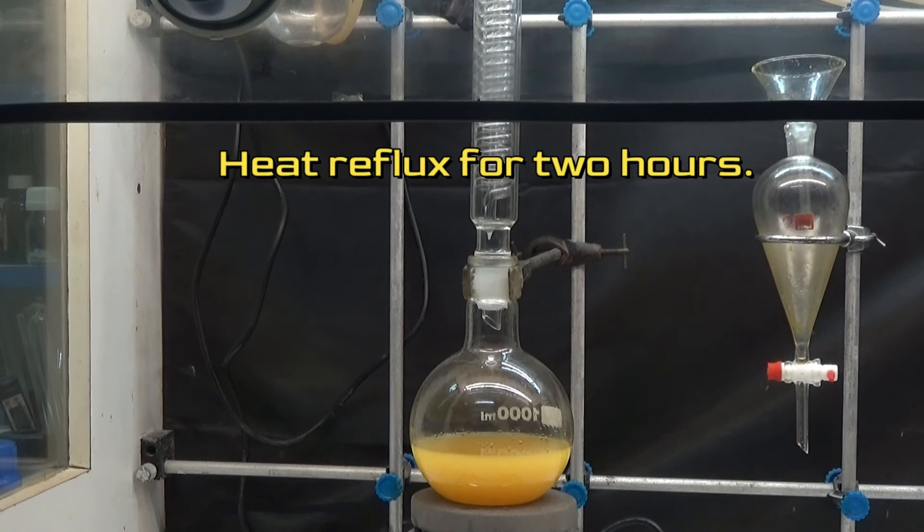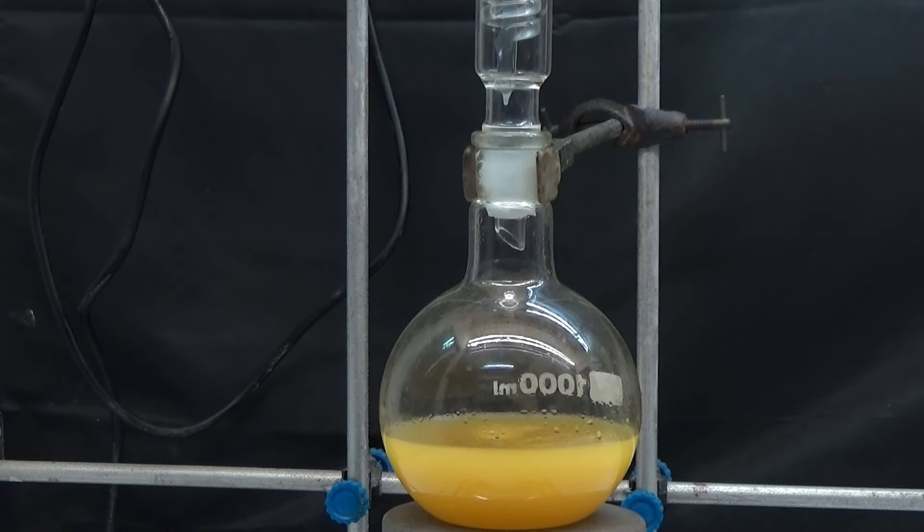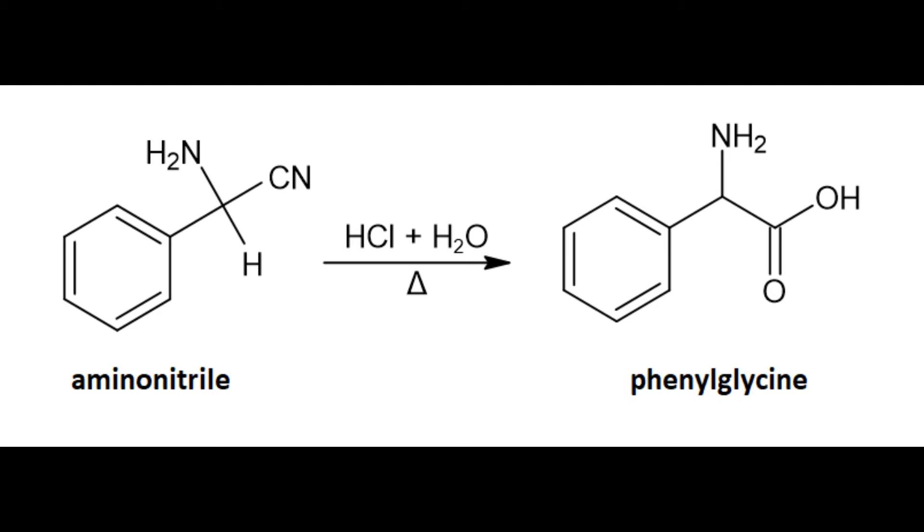Heat the aqueous phase containing hydrochloride at reflux for 2 hours. In this step the nitrile is hydrolyzed and forms the carboxylic acid.